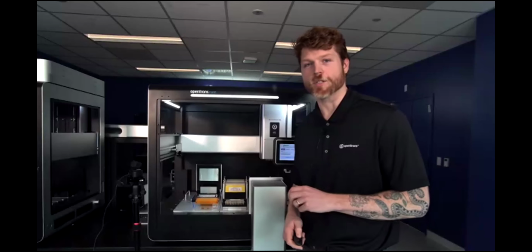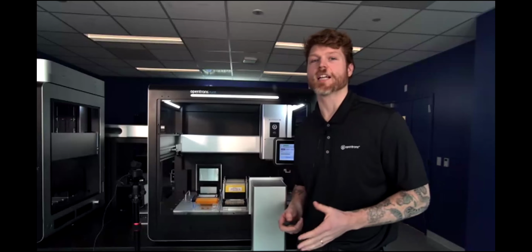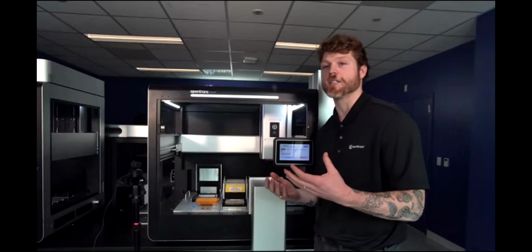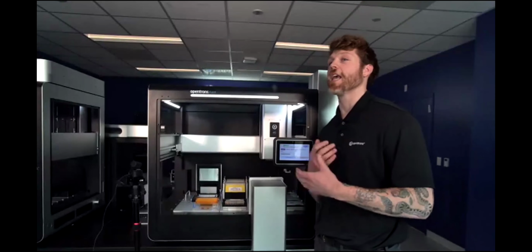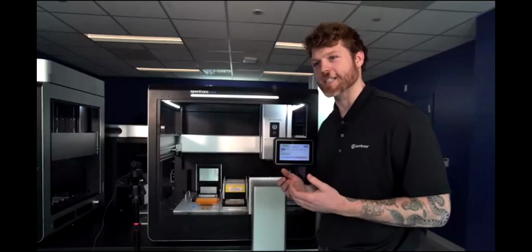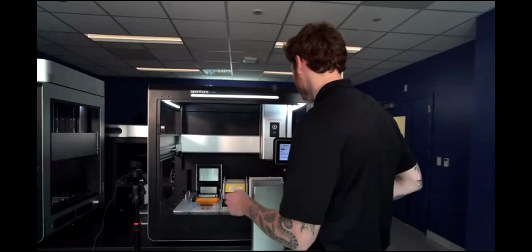Always really cool to be able to jump into the science that we are enabling here, as well as the technology, right? The hardware and software that we are continually working on to supply to the customer base in order to work on these solutions. But as always, very interesting to see how much complexity you can actually start to accomplish on our systems.